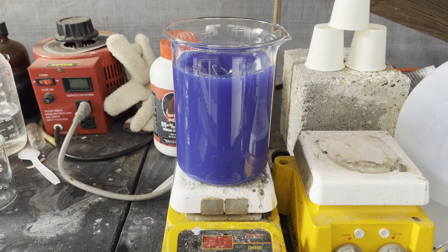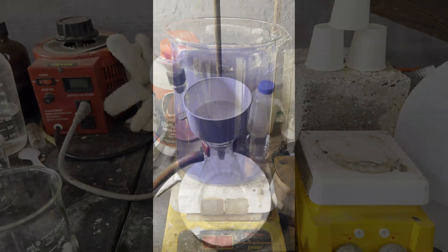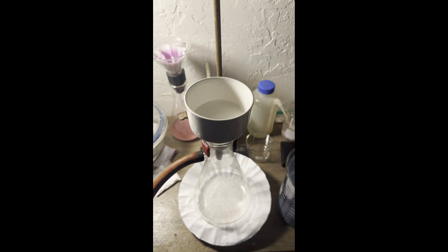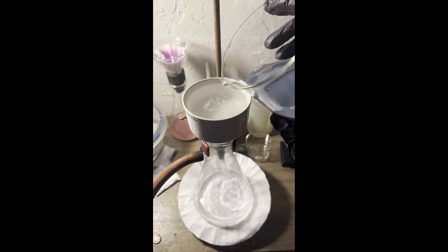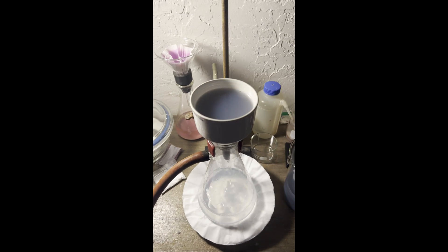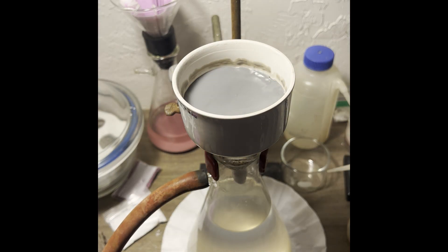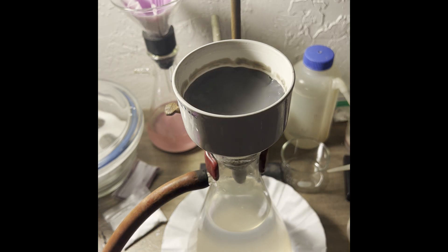During the 30 minutes of stirring, the color of the precipitate dulled to a dusty blue. The supernatant liquid passed through the filter quickly, but once the precipitate hit it, it slowed down considerably. A small amount of superfine precipitate did pass through the filter paper, but it's inconsequential — the solution looks cloudy but clears once it settles. All in all, the filtration took three hours. Afterwards, here's the gelatinous filter cake — it looks like a lot more than five grams, but it's a voluminous gelatinous precipitate and that's how they are.